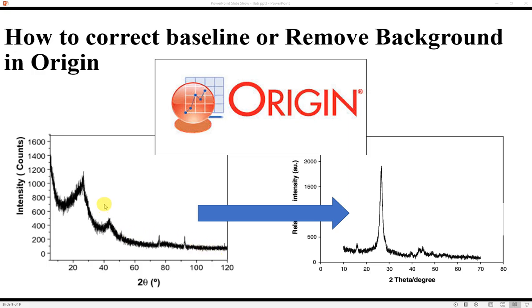So many people have used these curves directly in journal publications, theses and presentations, but it doesn't look good. Compared to this graph, the graph on the right-hand side is much better because it has less background, and the baseline is pretty smooth. So today I will teach you how to set or correct this baseline in Origin. So let's jump into the video.